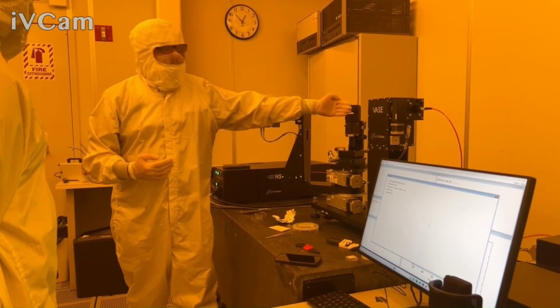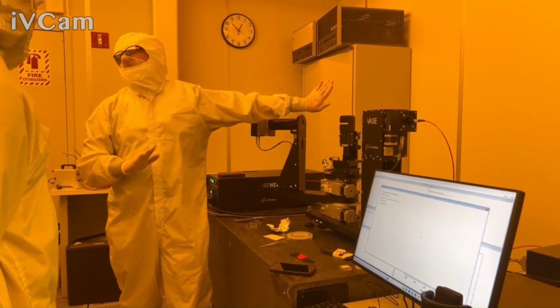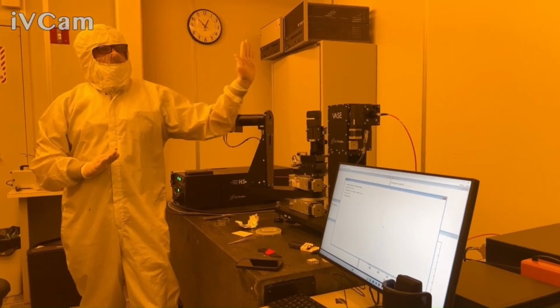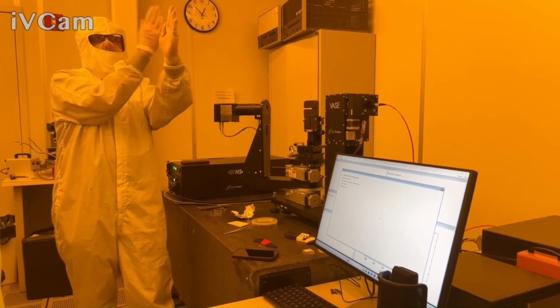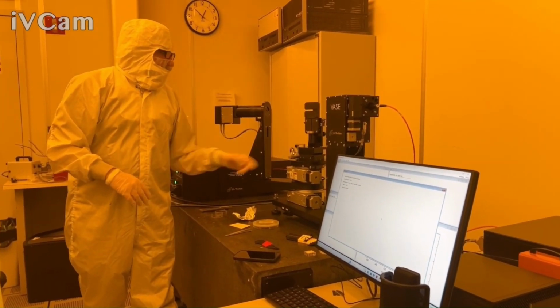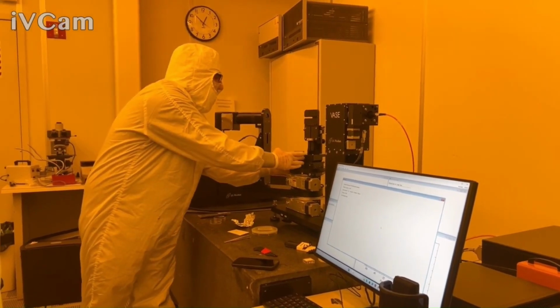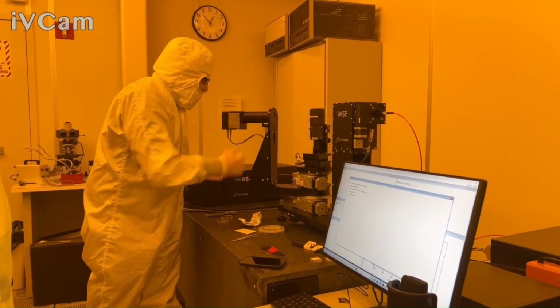Once it's there, it's kind of a trick. You can leave your sample mounted. It can move the stage to 90 degrees, and the sample's out of the path. You can figure out what the air looks like, and then move it to 0 degrees to go through your sample. It's just that when you align your sample, don't have the spacer in. But also, if you have a spacer here, make sure that this is all the way back when you're doing actual reflection type measurements.